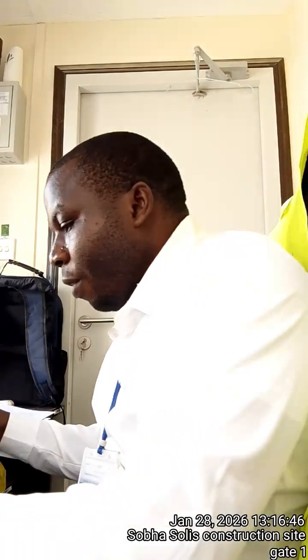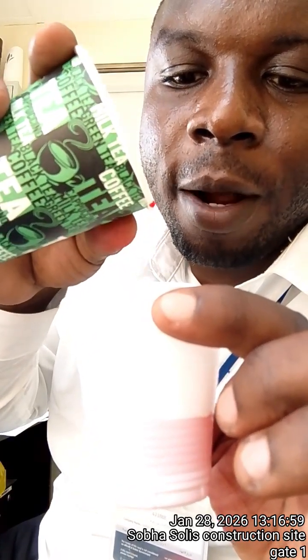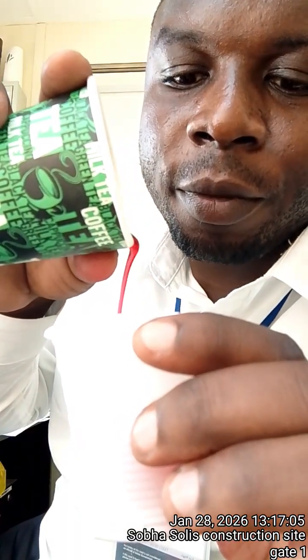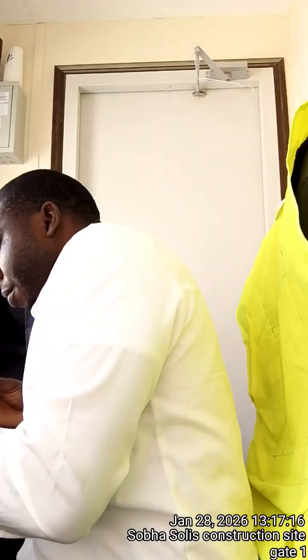Then I'm going to use these for my experiments. I'm going to use this pigment. So here we go. If I add to this water, this is drinking water, it is clear. But if I add, I think you'll observe something like that. I'm trying to attain the concentration. Don't worry, I have enough. I have something like a soda color.